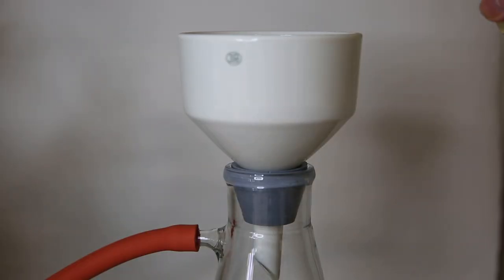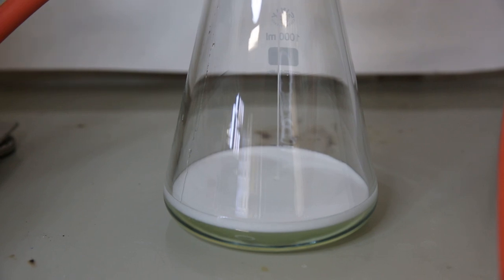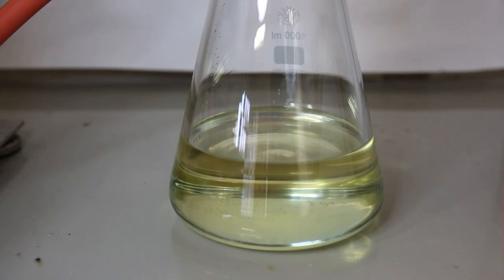After a while, the sunflower oil is dried, and I can remove the calcium chloride by filtering the oil through a paper filter with vacuum filtration. The vacuum makes the oil foam a little, but after a while it stops and we can see that the oil is clear again.